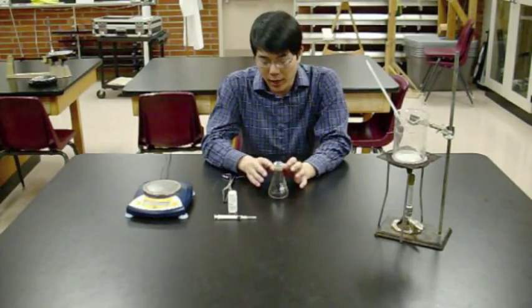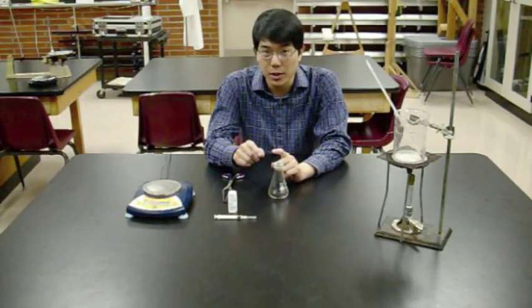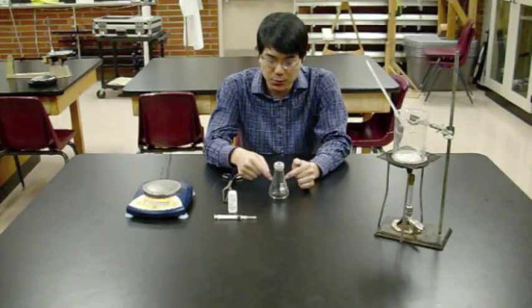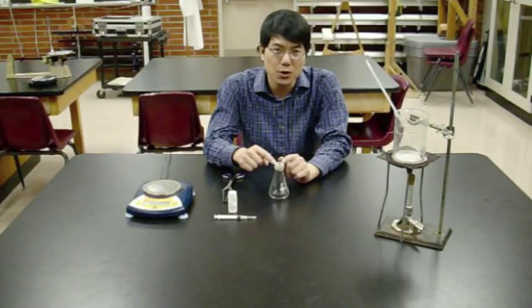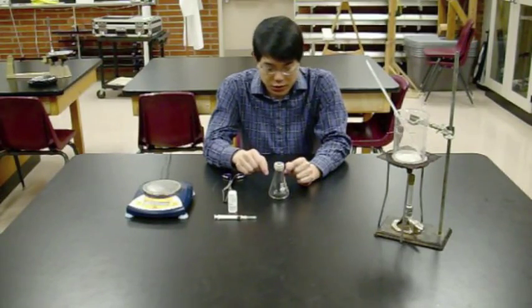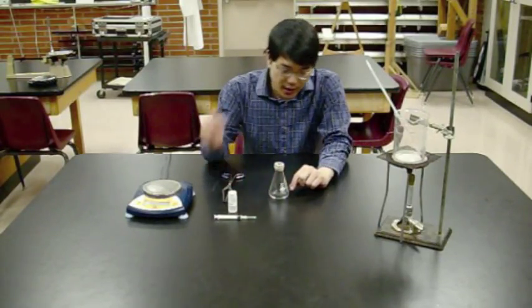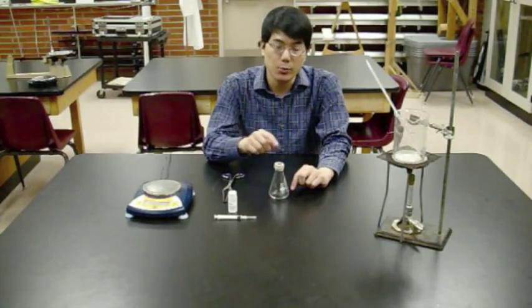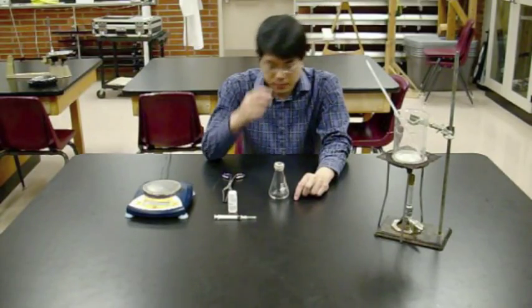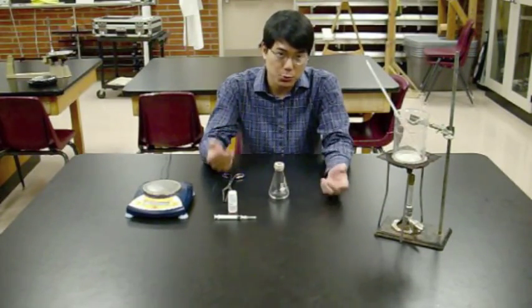Wait for it to cool back down. Your mass measurement before heating had the glass, rubber bands, aluminum foil, and air inside the Dumas tube. Now let the unknown vapor condense back to a liquid so air gets back in. The before measurement was Dumas tube plus air. The after measurement is Dumas tube plus air plus condensed vapor. Subtract the two to get the mass of your condensed vapor.